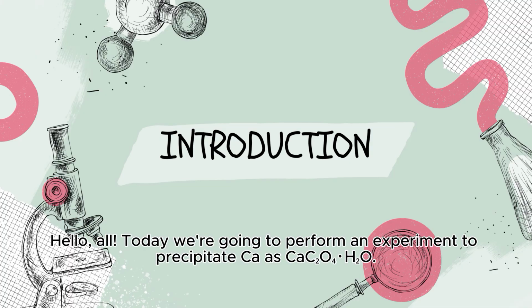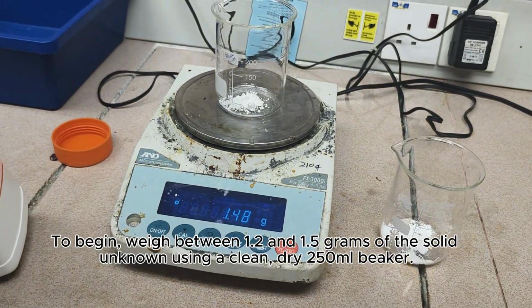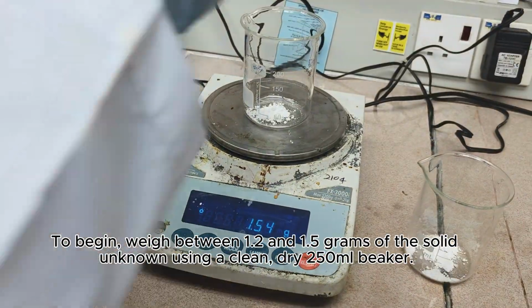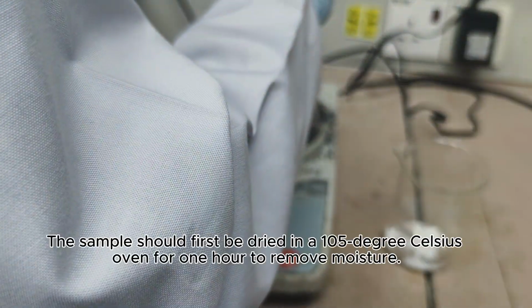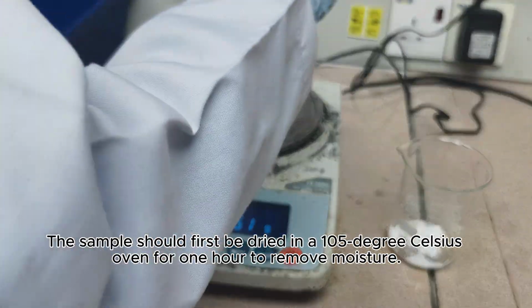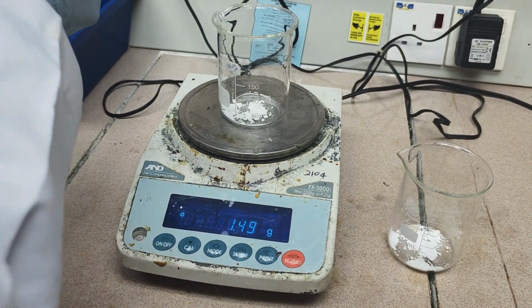Hello all, today we're going to perform an experiment to precipitate calcium as calcium oxalate monohydrate. To begin, weigh between 1.2 and 1.5 grams of the solid unknown using a clean, dry 250 milliliter beaker. The sample should first be dried in a 105 degrees Celsius oven for 1 hour to remove moisture.